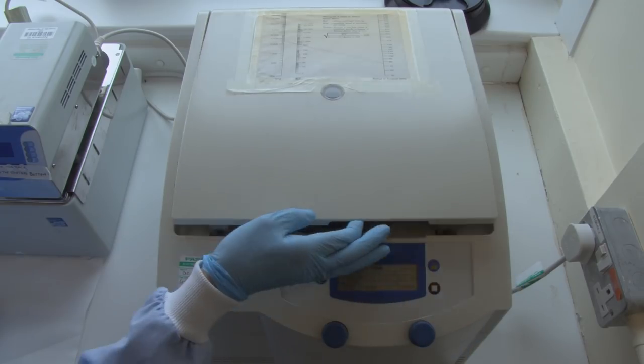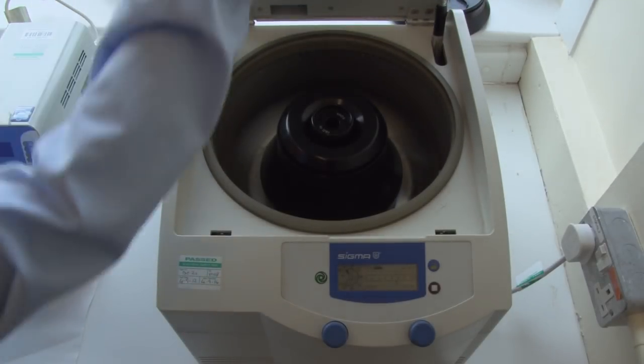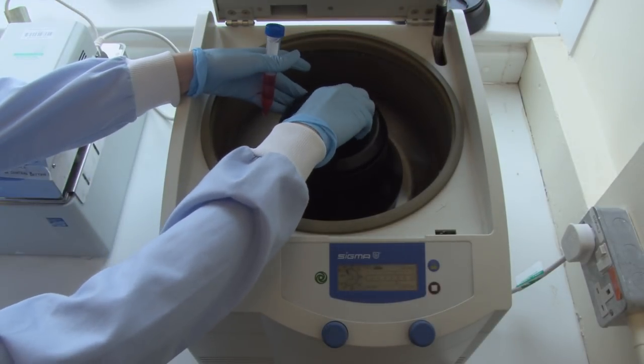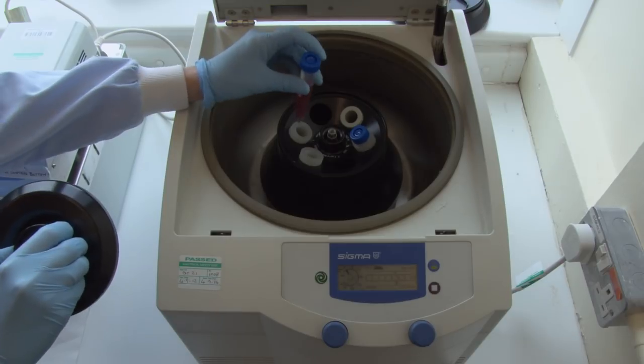Open the centrifuge and load the sample. Make sure that there's a counterweight before shutting the lid.